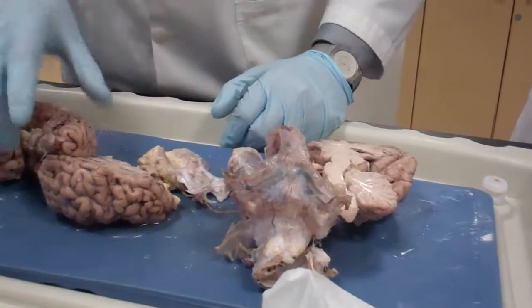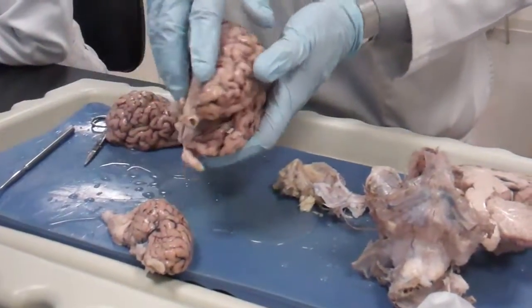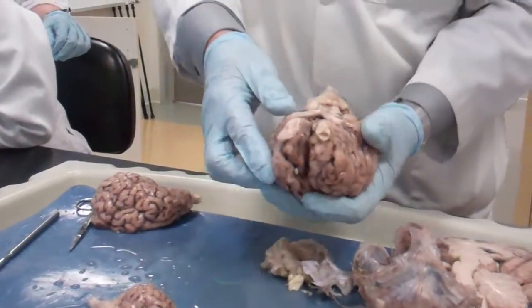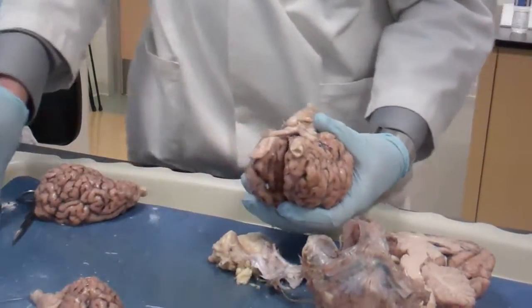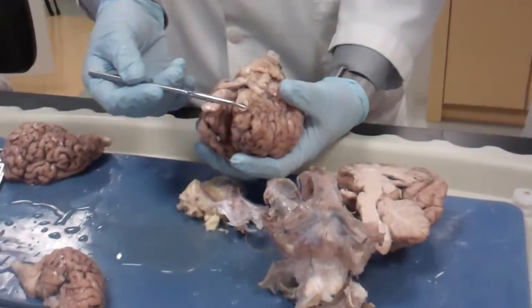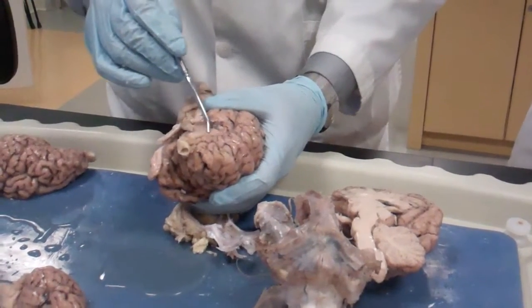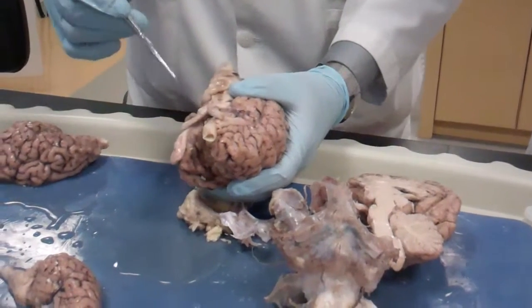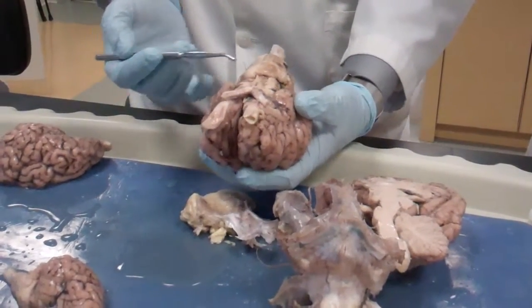What else can you see from the outside? Let's put this together. Do these belong to each other? Yes, they do. Olfactory bulb. Olfactory tract, right here. So it's going from two different ways — right and left.